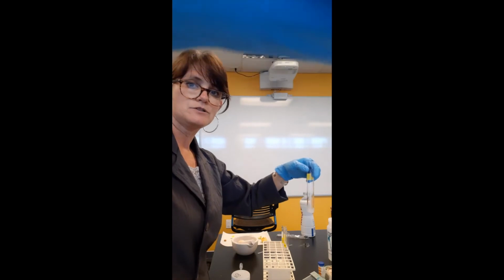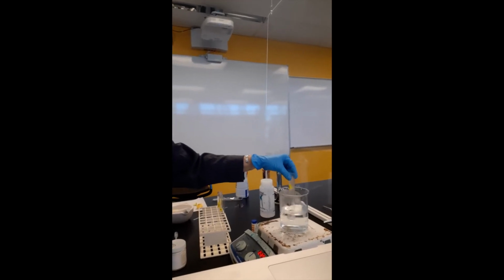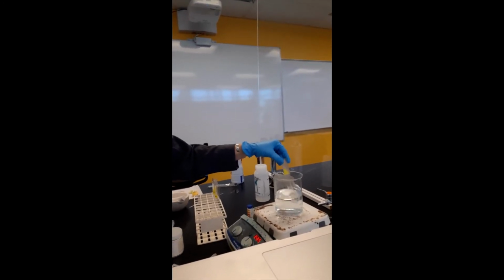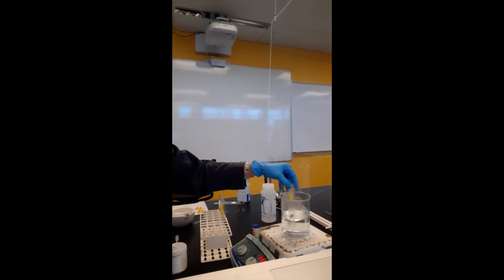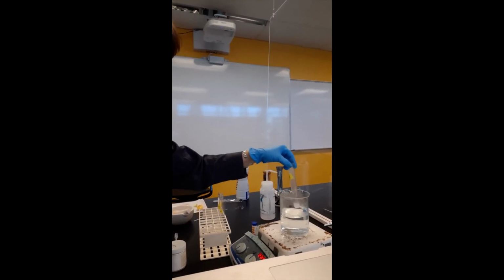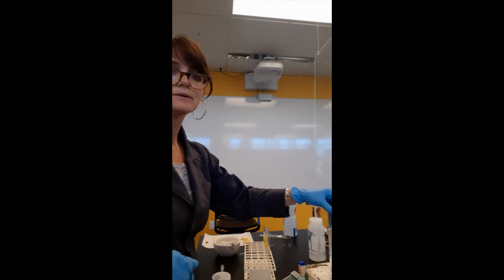And now I'm going to heat my sample. Anytime we add heat to a reaction, it speeds up the rate at which the molecules are interacting with each other. Temperature is really just a measurement of how fast molecules are moving. So when we add heat, we make molecules move faster. When we make molecules move faster, we increase the rate of the reaction, right?